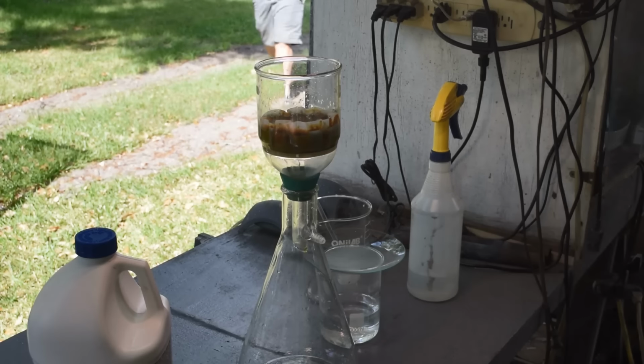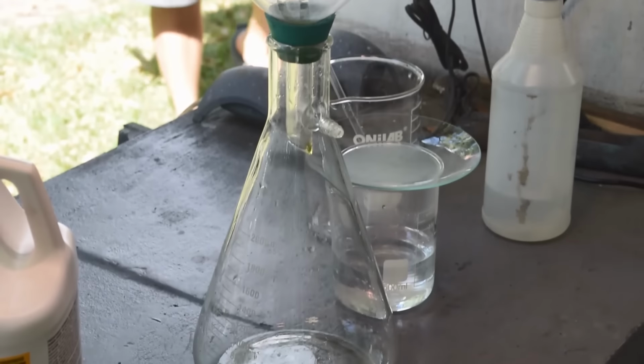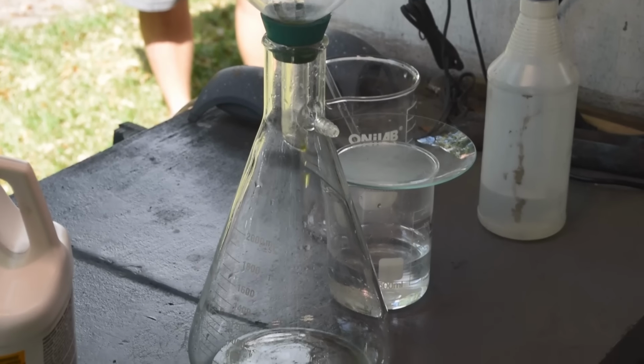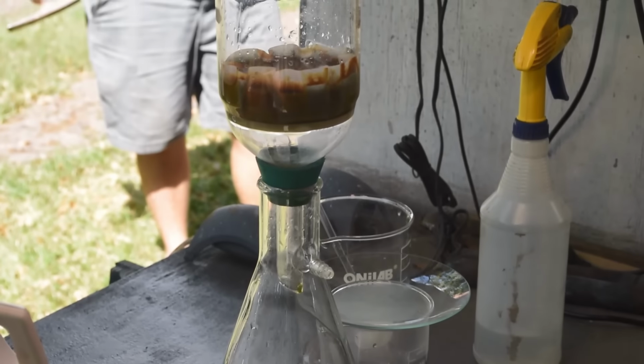I mean, look at this. This is coming through green. It's coming through green. So, yeah, that tells me we are dissolving metallic hydroxides and getting them out of our gold.